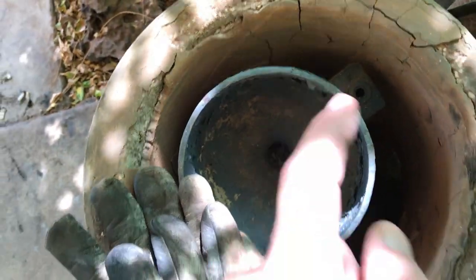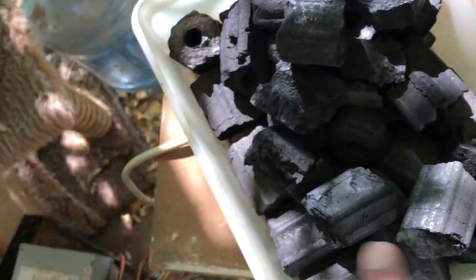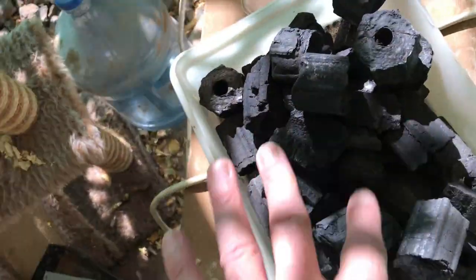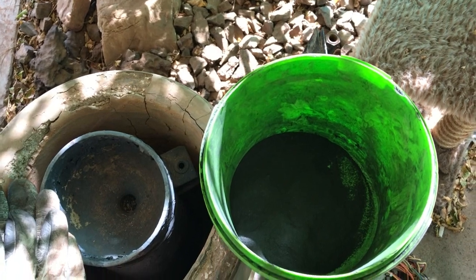I'm going to try to carbonise two of these pieces. I'm going to put them in the crucible. First I'll put some powdered carbon down on the bottom so it doesn't burn, then pack around it to keep it in shape and keep the air out so it doesn't burn to nothing. I'm going to crank it up to probably 800 degrees and keep it for four hours.